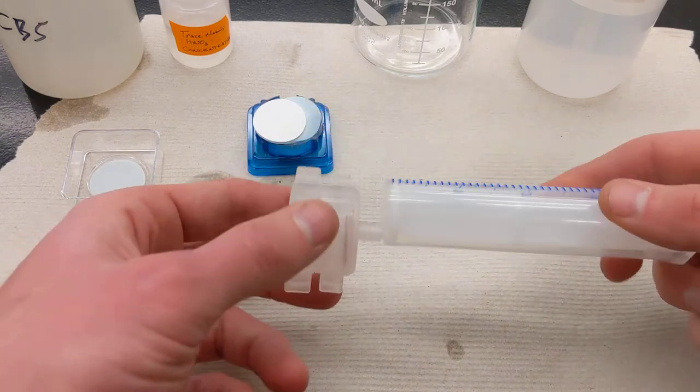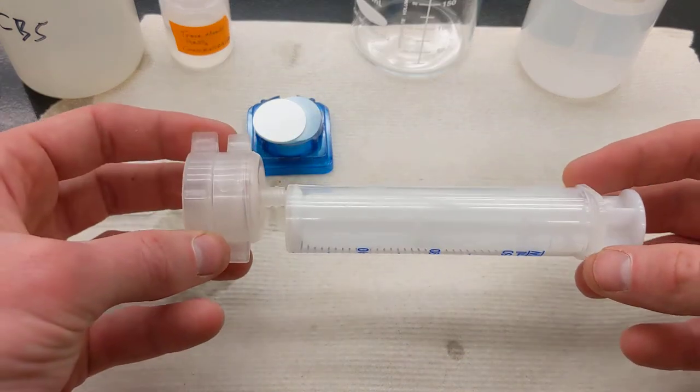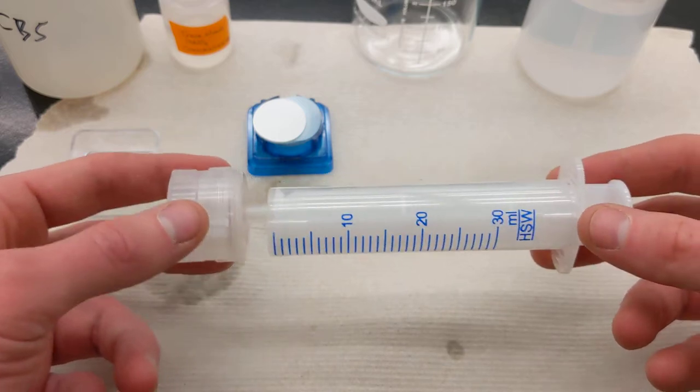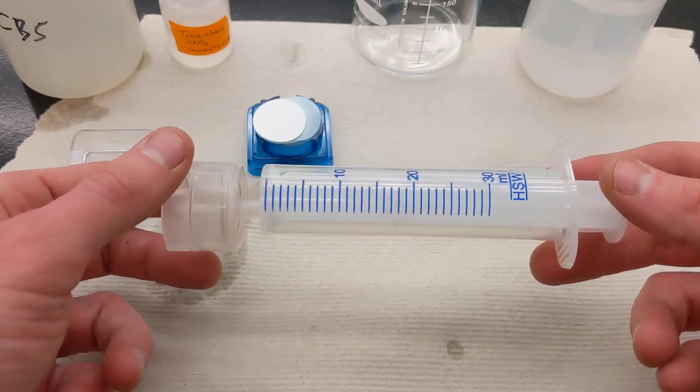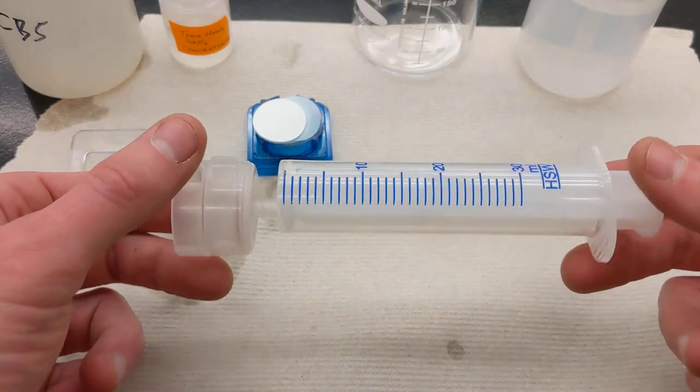Okay, this is a quick video to walk you through how to use a syringe filter setup, typically used for things that are less than 100 mils. Anything more than that, maybe a vacuum filtration flask will work.